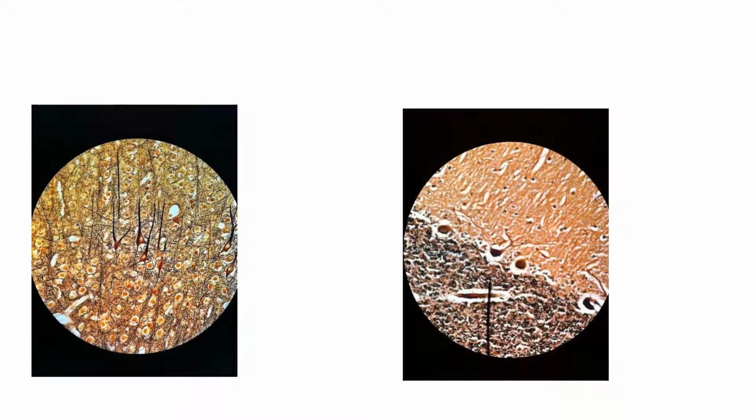In this microscope slide, what you're seeing are actually a couple of things. These cells right here that look like little triangles are called pyramidal cells because they look like little pyramids. They're found in the cerebral cortex. And over here, this is the cerebellum. Right on this border between the gray and white matter, you're going to have these little cells that kind of look like they have a little tail. These are called Purkinje cells. So Purkinje cells in the cerebellum, pyramidal cells in the cerebral cortex.